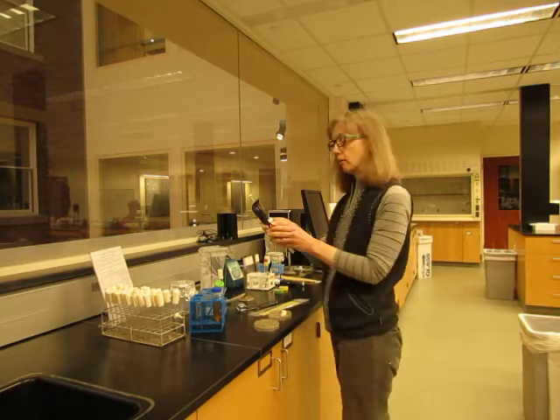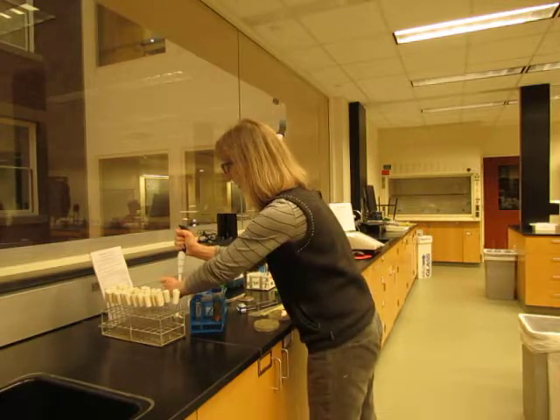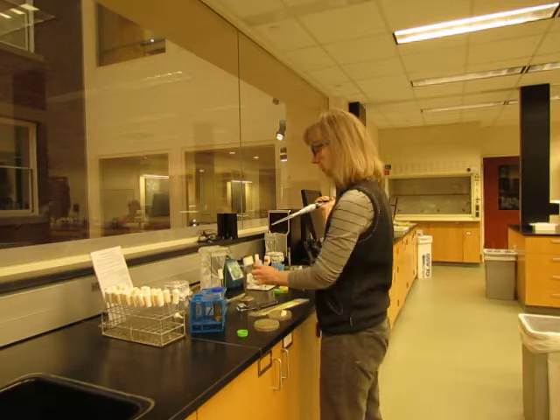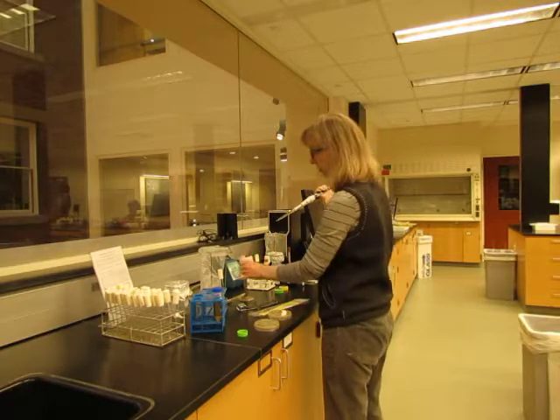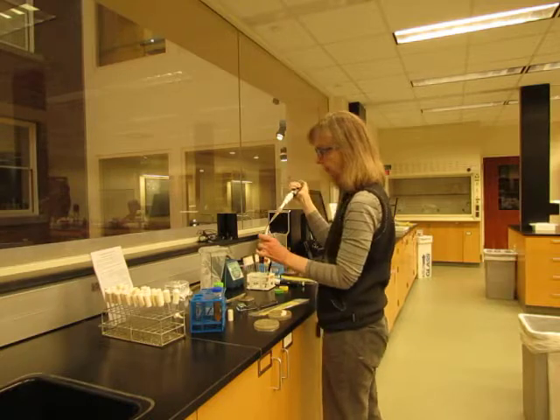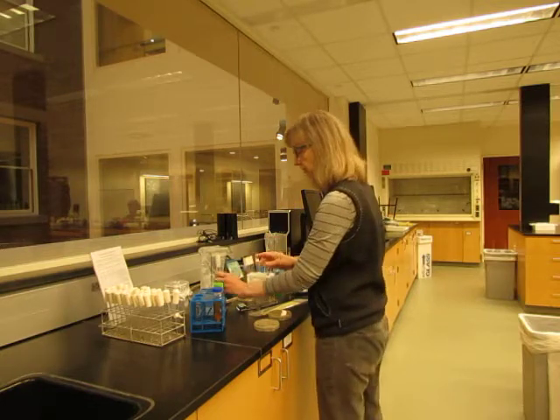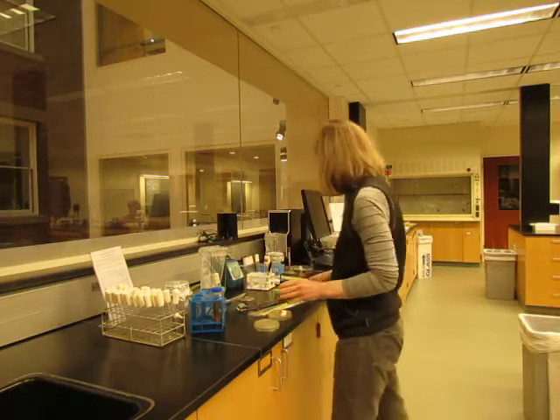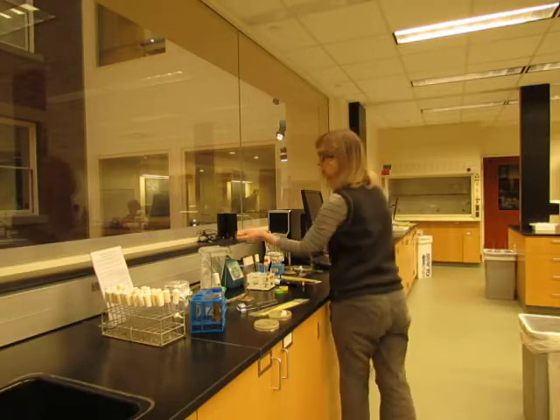I have a P5000 pipetter set to deliver 5000 microliters, or 5 mils, of media. The sterile tips are here — please keep them covered with foil. Pipette 5 mils of media, grab the top, and dispense it into the test tube. At this point you can lay that down, briefly flame again, and put the tube there. Then re-secure the top on the media to keep it sterile. These P5000 pipetters don't have an expeller, so just grab the tip and dispose of it in the plastic bag provided.